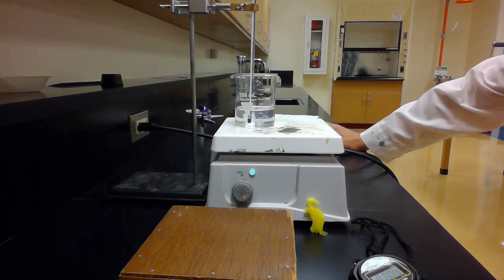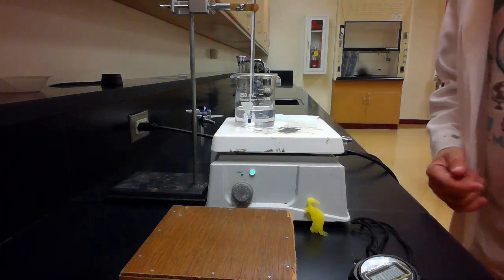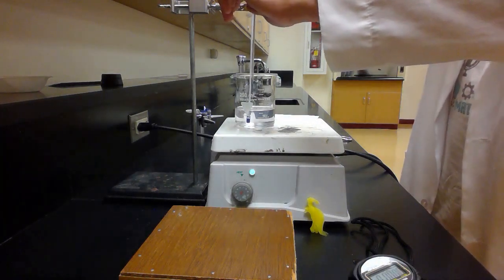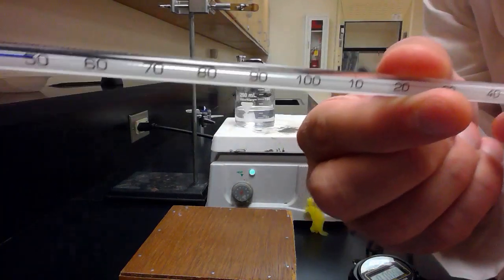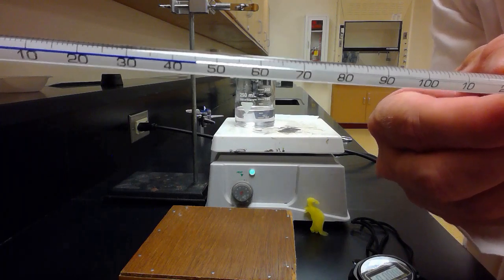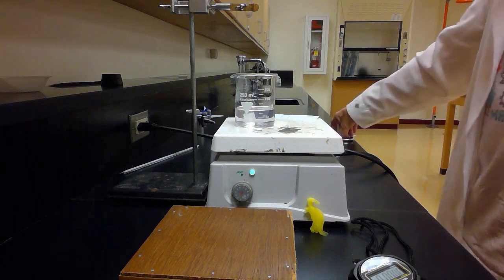Alright, here we are with the alkaline water. It's getting pretty close to 50 degrees Celsius here. And I'll try again to show you the thermometer, but it might drop before I can get it in front of the camera. Yeah, see, you can see it was at 50, but it drops so fast that it's hard to show you.